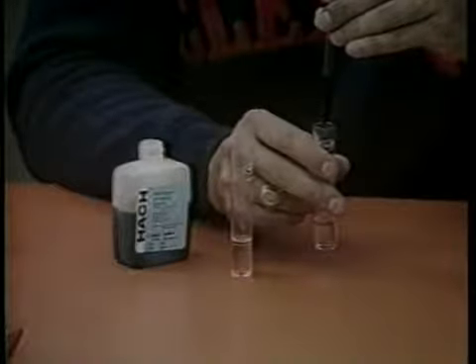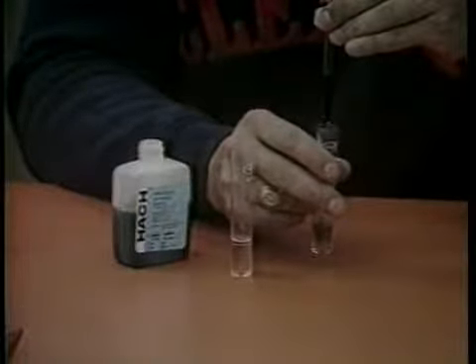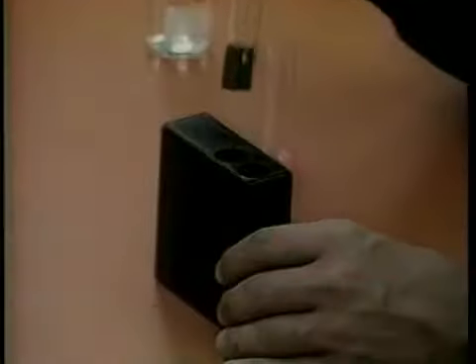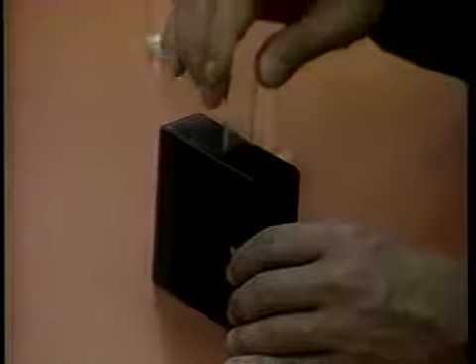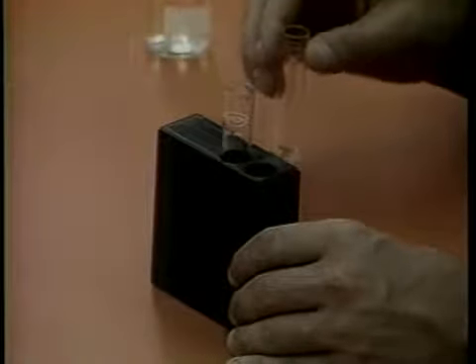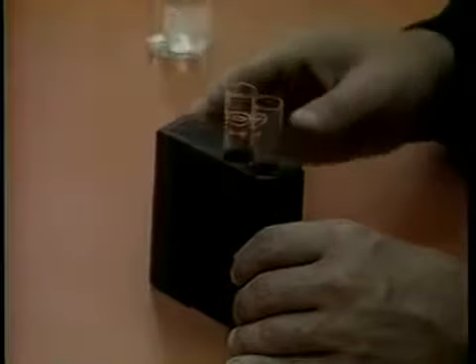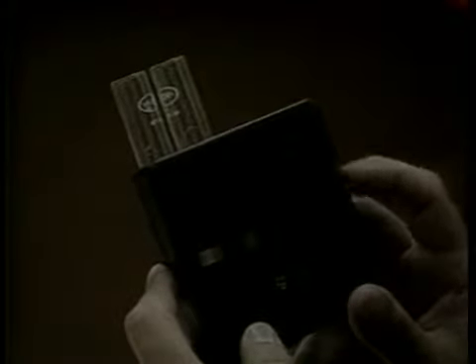Add 6 drops of wide-range pH indicator to one of the tubes and swirl to mix. Insert the tube into the opening on the right side of the color comparator. Insert the other tube into the left opening. This tube is the untreated sample and simply cancels out any color resulting from the pond water. Hold the comparator up to the light source and rotate the disc until the color on the wheel matches the color in the sample. Read the pH through the scale on the window.